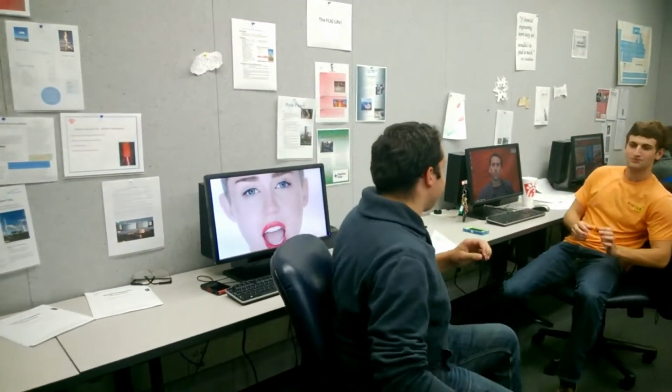Hi, I'm Andrew Cressman, and I will be discussing how to use the falling sphere viscometer. I'm not actually in this lab.